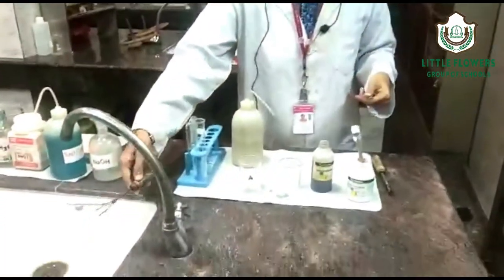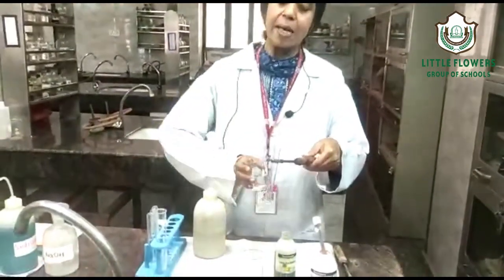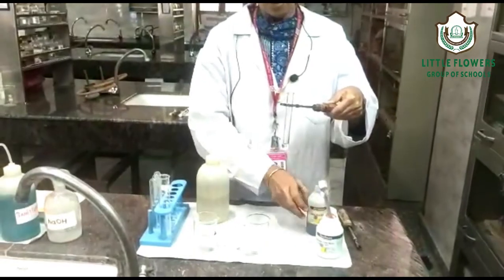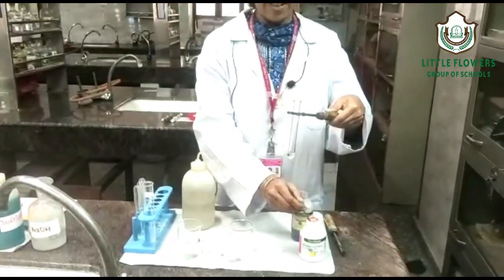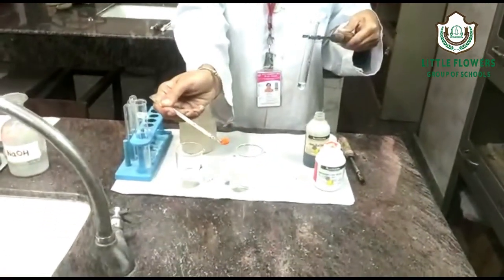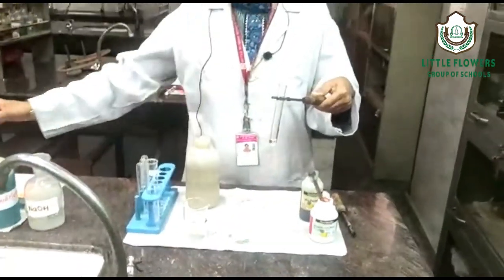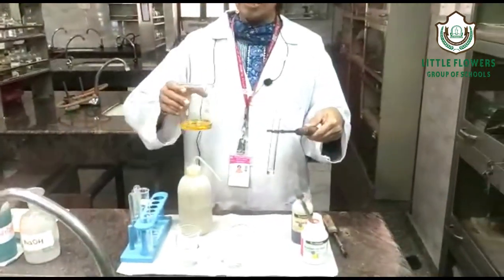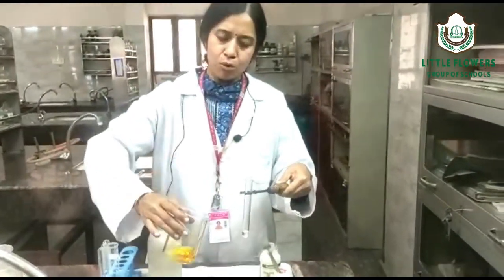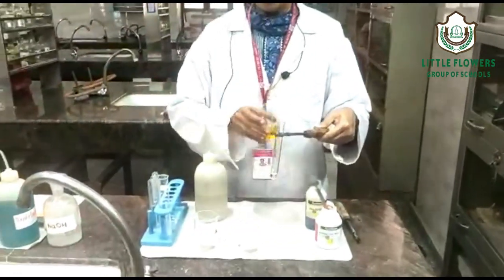Now we do the confirmatory test of this organic compound — which function group is present? We take a few ml of organic compound. In this organic compound we add ceric ammonium nitrate solution. This is ceric ammonium nitrate — it is an orange color powder. We will prepare the solution of this orange color powder. This is the ceric ammonium nitrate solution.